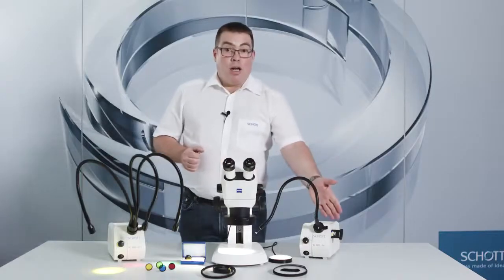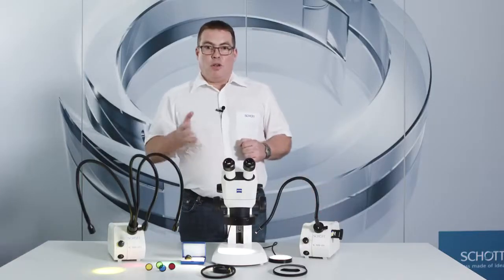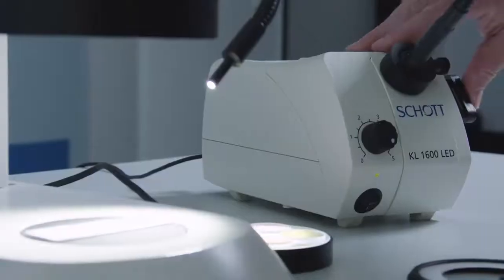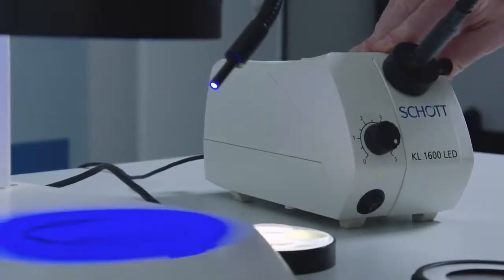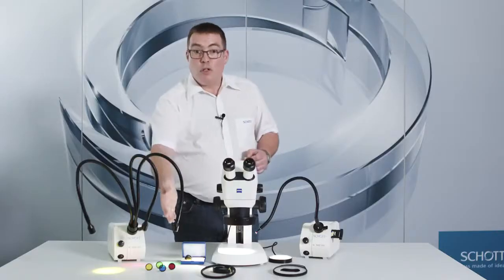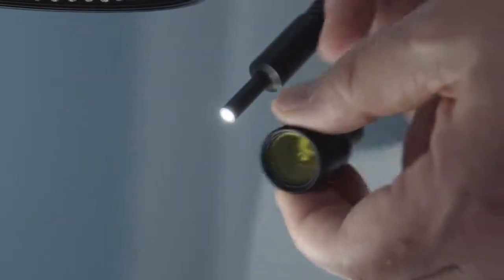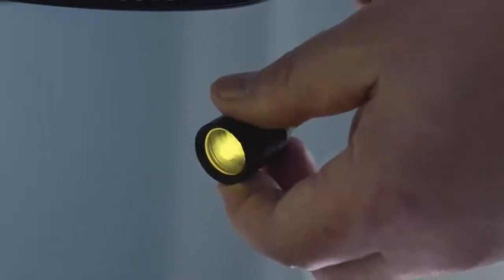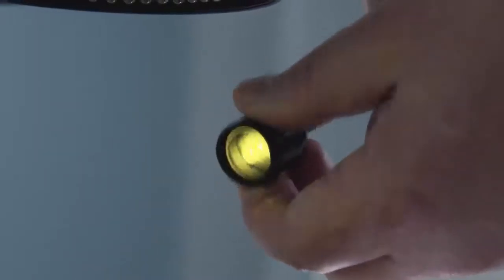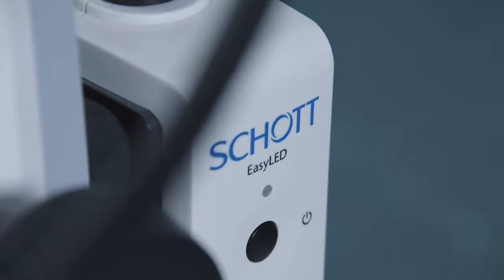If your cold light source has a filter holder, you can insert suitable color filters directly at the light source. These will then work with all types of fiber optics. Also available are screw-on filters for the focus lenses of our goosenecks and flexible light guides, as well as for our easy LED spots.